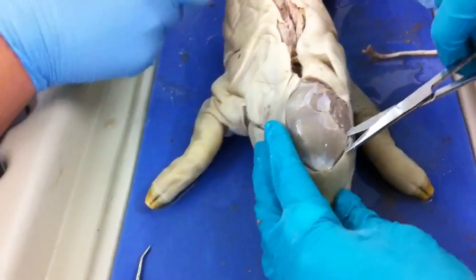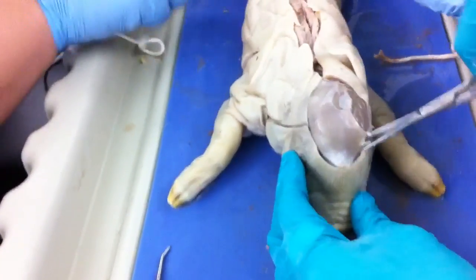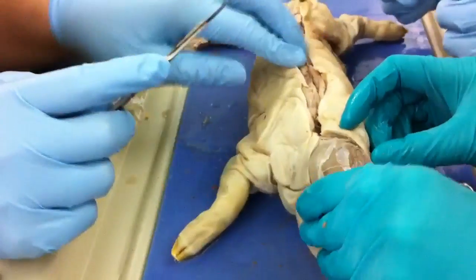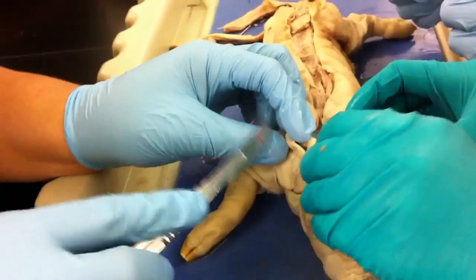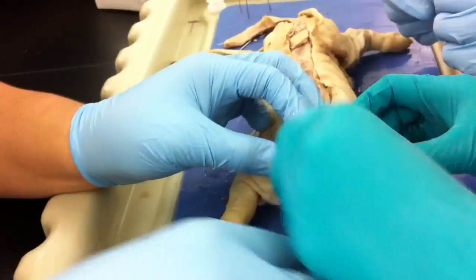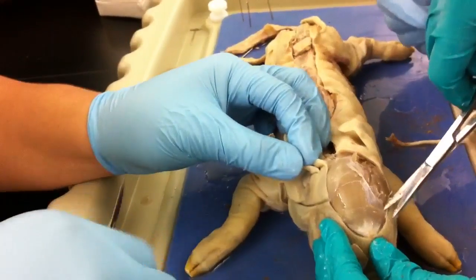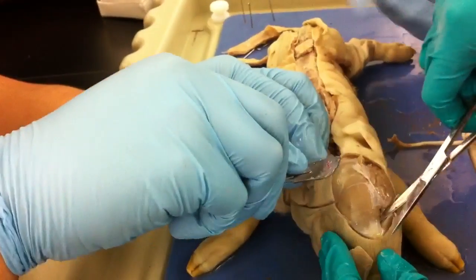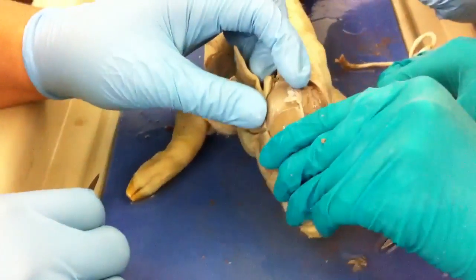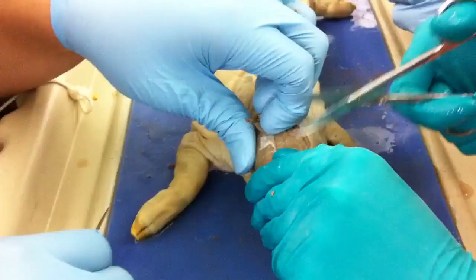Did you cut it off? Oh man, this guy's studying, he's not even paying attention. He has extra credit. I don't really care anymore. What are you trying to do here? It's like eating balut. Yeah. Want some balut? It smells good. It smells like Armani. Armani? Yeah, they cut right there.